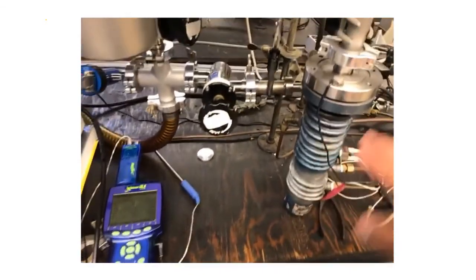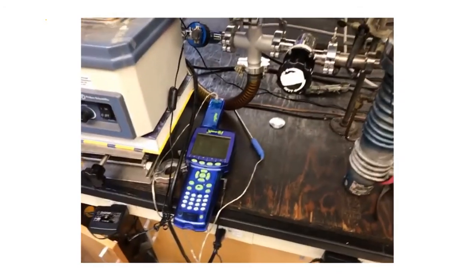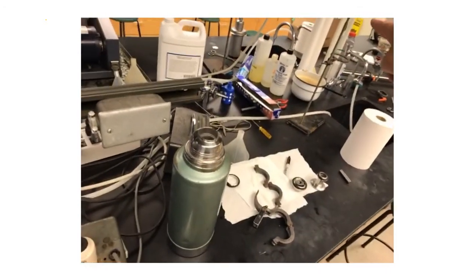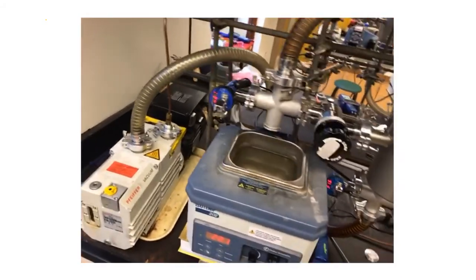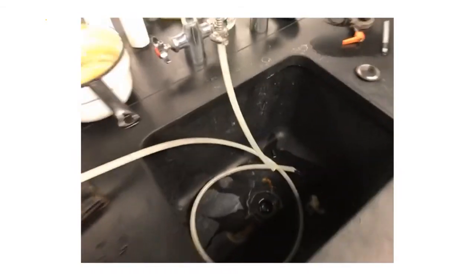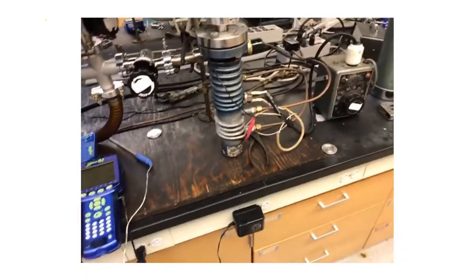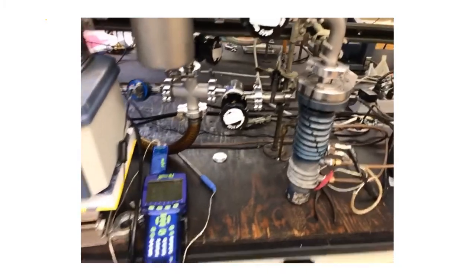vaporize, condense. We need to flow water through the upper condenser coils, so I have water running. The water actually runs from the far sink across to the back of the apparatus. It feeds both sides—we have two stations—and then we're just feeding our side. We can see in the sink we have water for our condenser draining into the sink. I'm just running with just enough flow of water to keep these coils cool during the experiment.